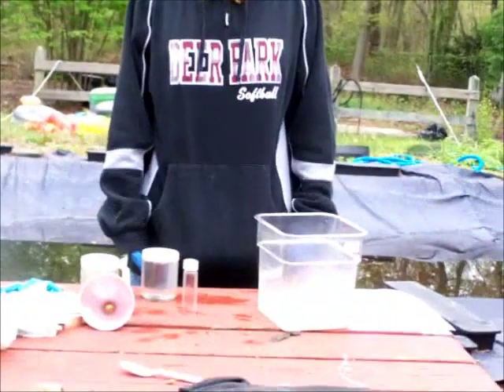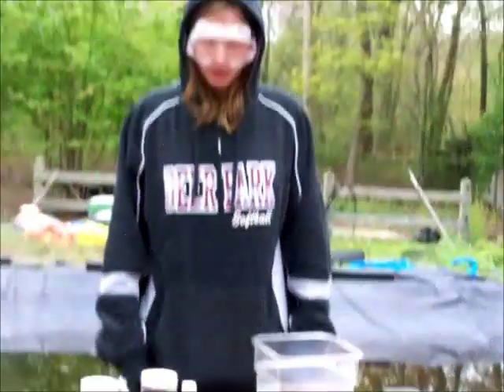This is my science fair experiment on Fenton's reagent. Fenton's reagent is a chemical reaction in which iron will act as a catalyst to produce free hydroxyls.